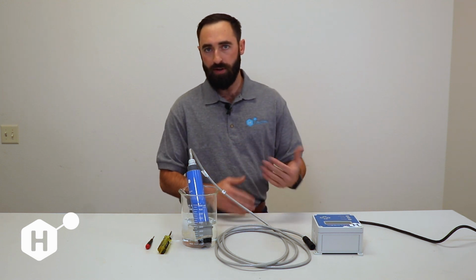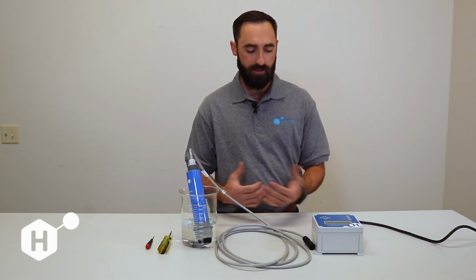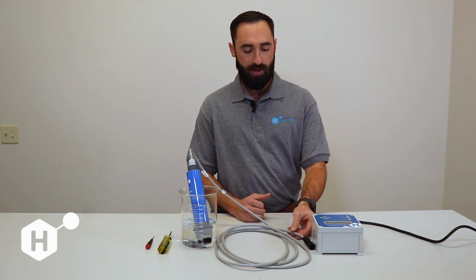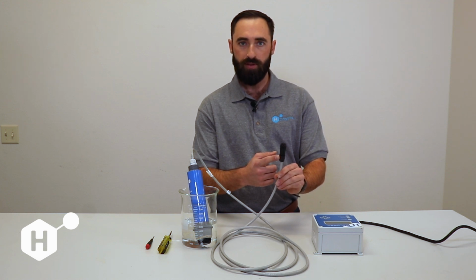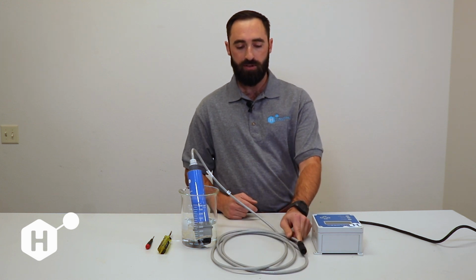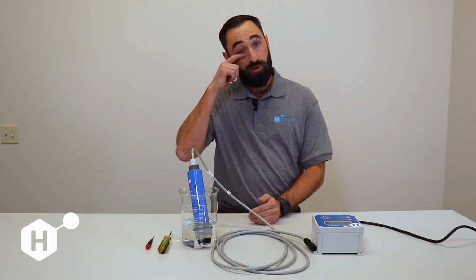The things that I'm going to go over here are going to be applicable to both ballast water and municipal water sensors. The primary difference between ballast water and drinking water is going to be the type of cable connector. All of our municipal water sensors have this M12 connector on here, and all of our ballast water sensors will just have the 4 leads coming out of the junction box. Most of what we're going to try is going to be similar between both.